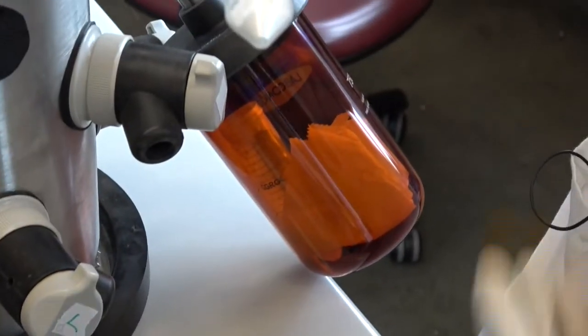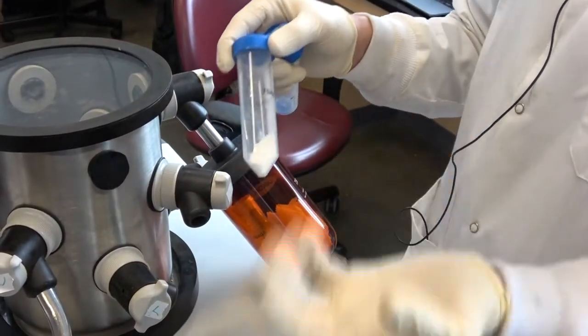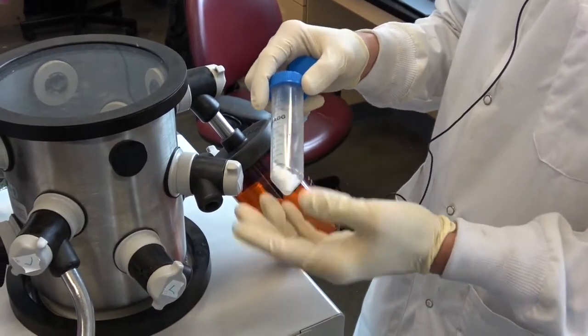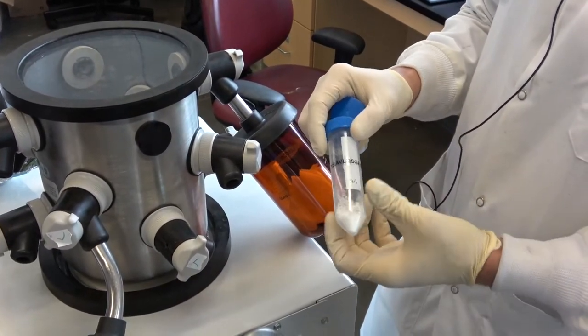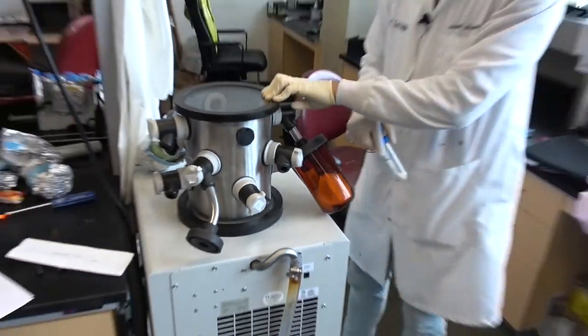This is stable, you can store this at room temperature. It's basically a way of purifying and stabilizing a number of different materials. So this obviously doesn't have any methylene blue in it, but this is what you would get as this particle was refined with this process. So this is what a lyophilizer looks like.